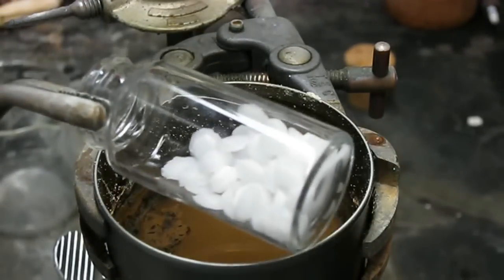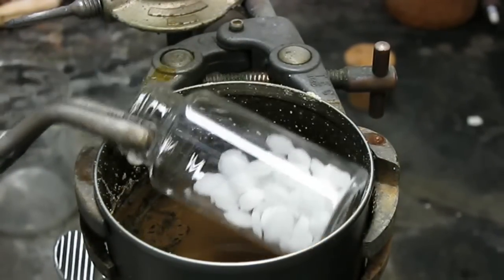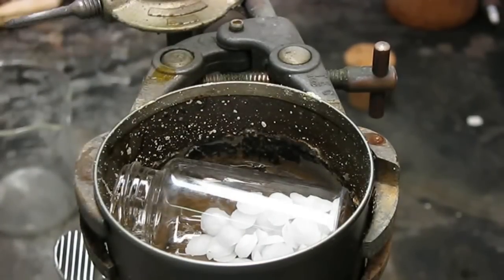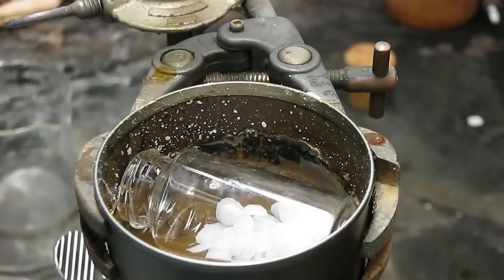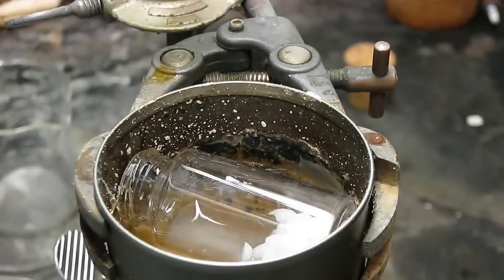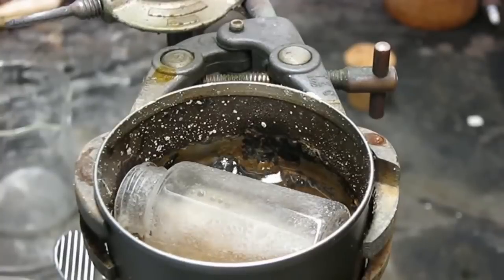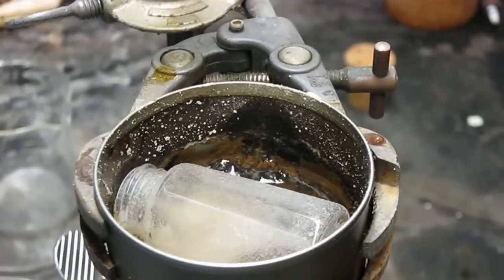Let's try this again with another vial on its side and with some sodium hydroxide on the inside to etch both sides and speed this up. There it goes. Molten sodium hydroxide also does wonders to human flesh, so do not do this yourself unless you're an experienced chemist.